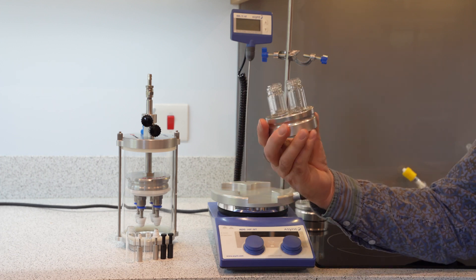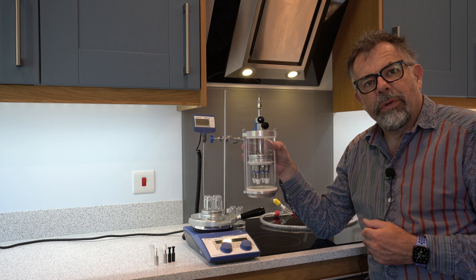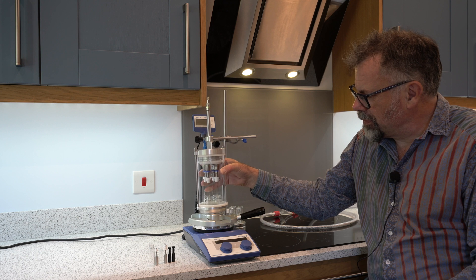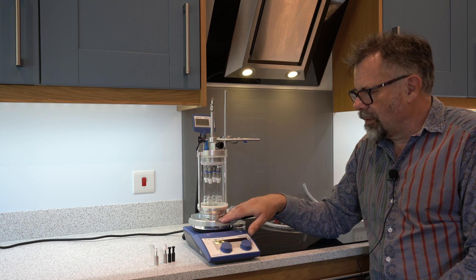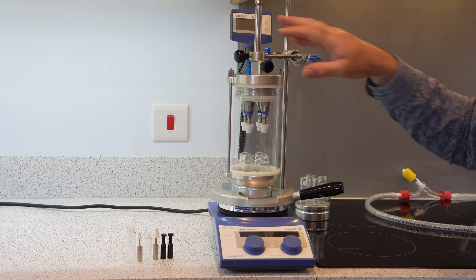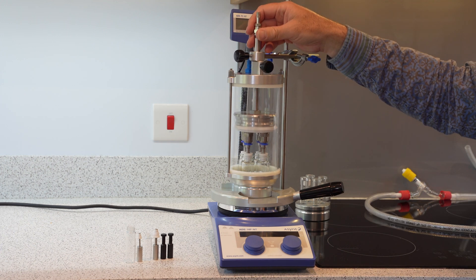A quite common format is one of these four-position blocks. The unit simply sits on top of the DrySyn four-position block — just put it into the centre of your multi-plate. We have this simple stability clamp; you don't necessarily need it, but it makes sure you don't knock it over. Then it's very easy to lower the spiral plugs into the tops of the tubes.